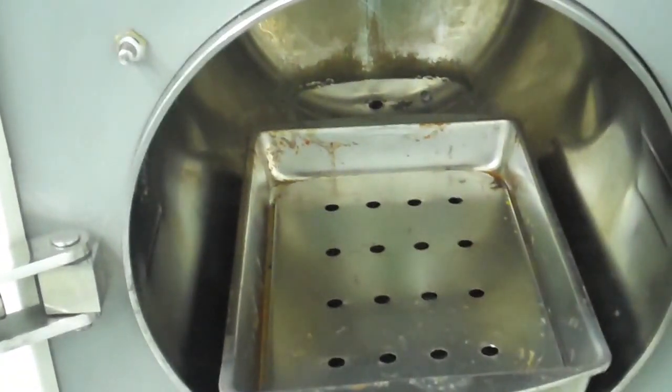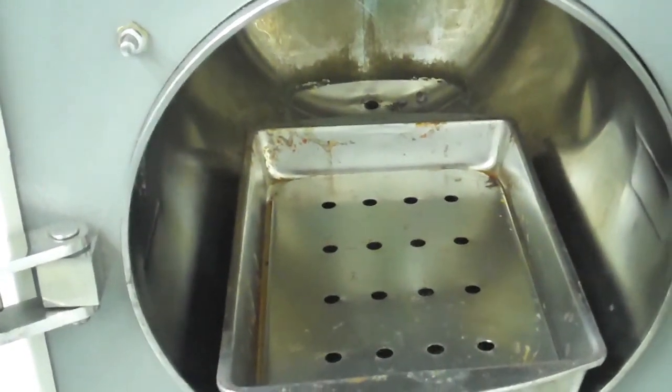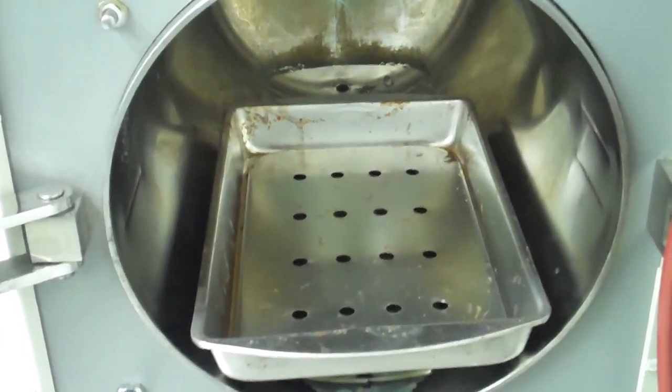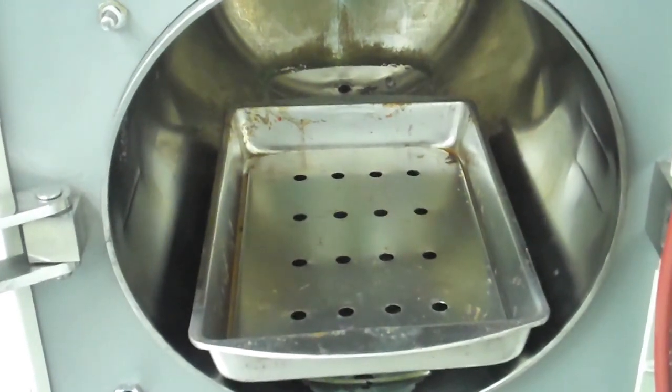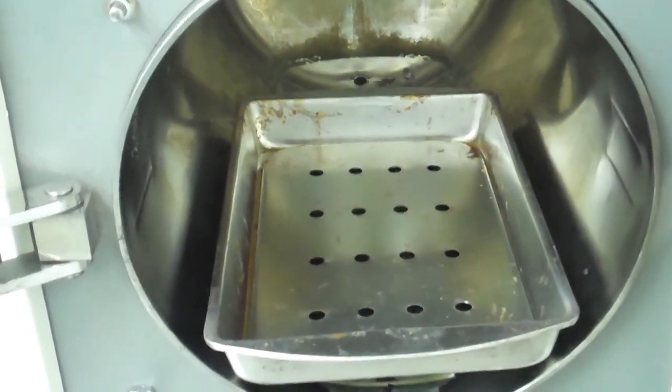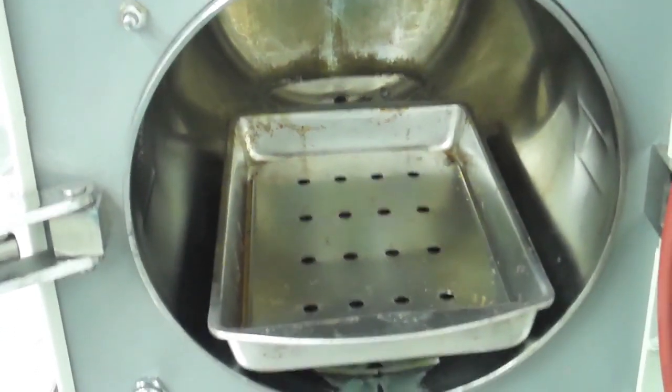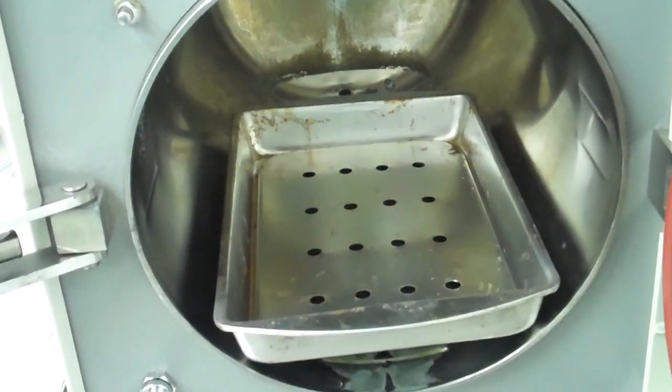In the rest of the training, I'll be talking about how you place things in there. If you have a flask with agar in it, you only do 50% full and you put a loose top on it and you put a capture tray underneath it to make sure that no matter what happens, you won't boil over into the base of the chamber.